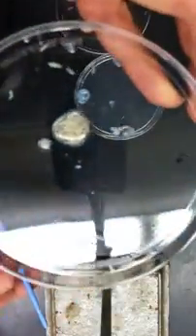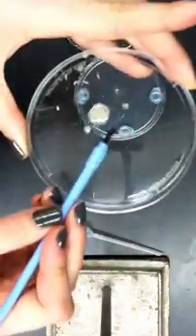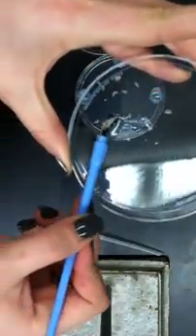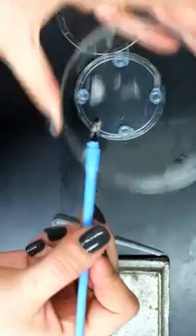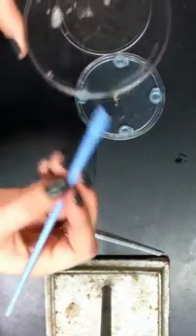So as you can see, they're all pulled up here, and we're going to just take them in one swoop like this, and you can come back for the rest, and just place them in the center.